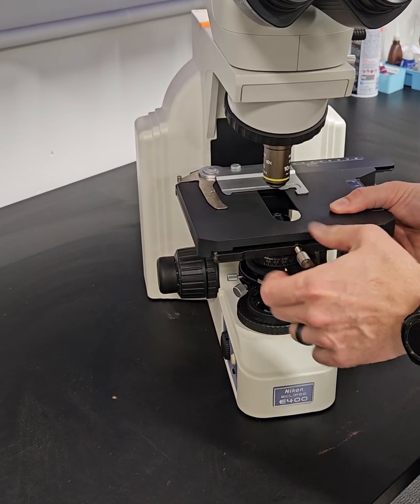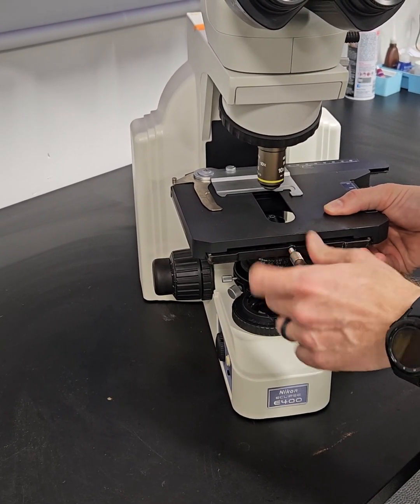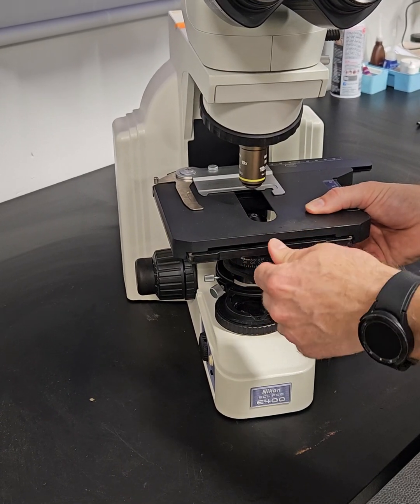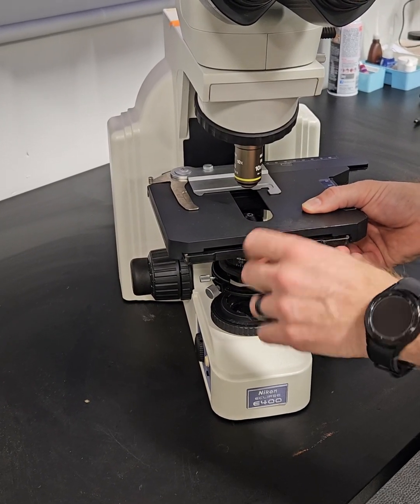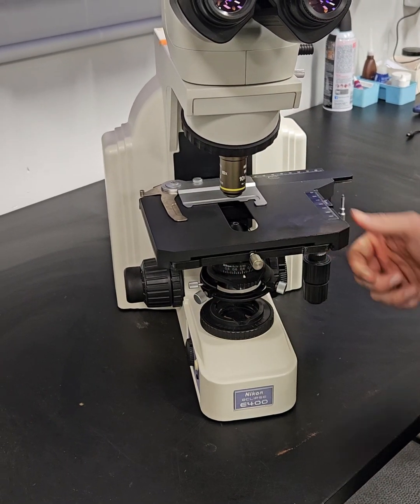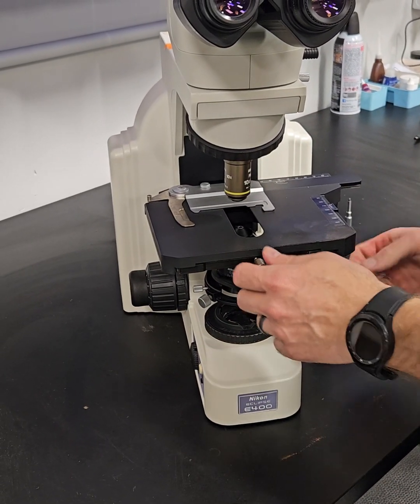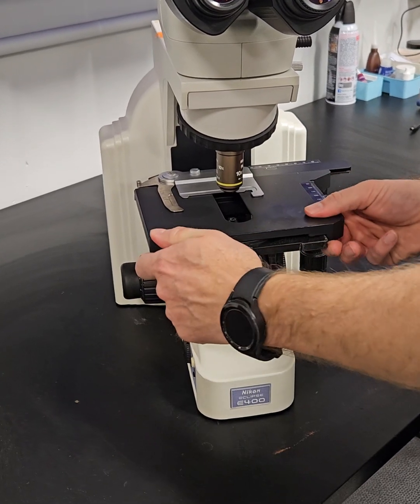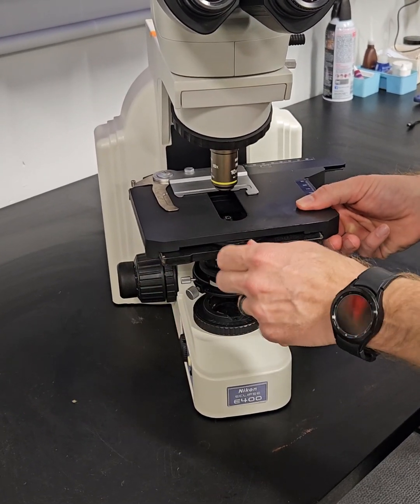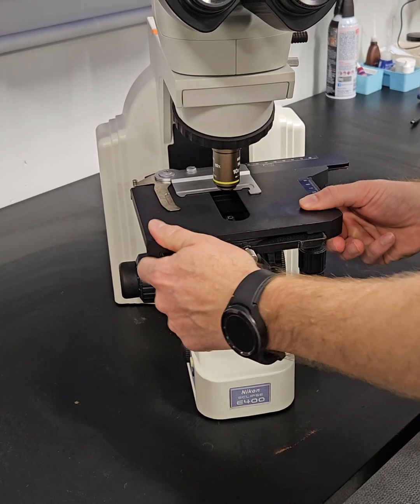This stage screw works on the E400, E600, the 50i, 55i, and the new current Nikon CIs. So see, now it's locked on. You can use the stage. It doesn't spin any longer. See, with it backed off, you lock it down, it doesn't spin.